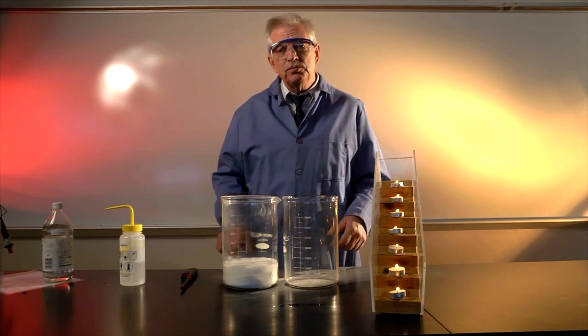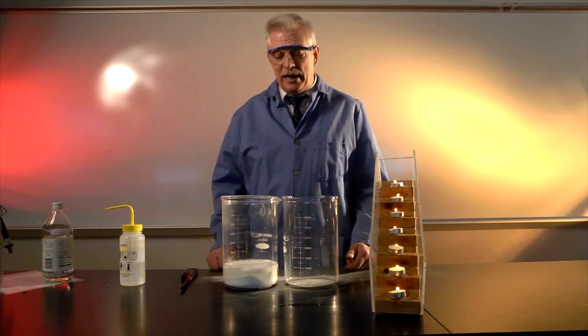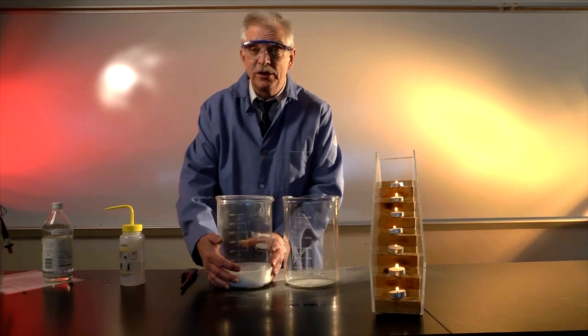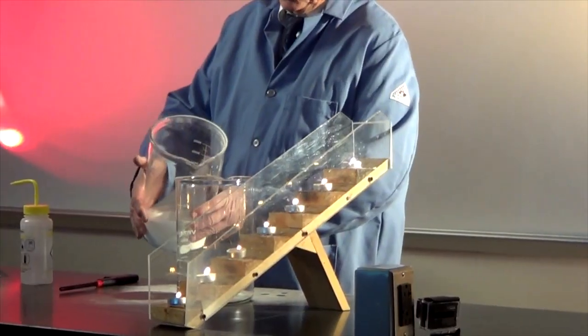So believe it or not, right now, this beaker is full of carbon dioxide gas. So we'll let it finish reacting in there a little bit. And now we're going to turn around and pour our invisible carbon dioxide gas into this other beaker.